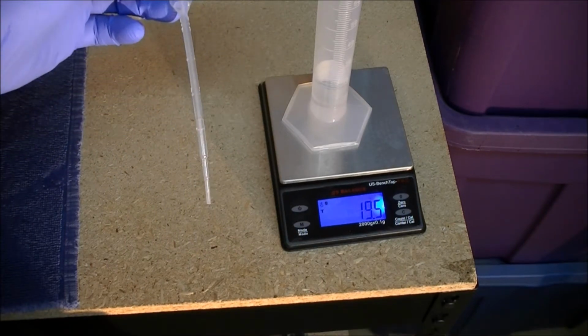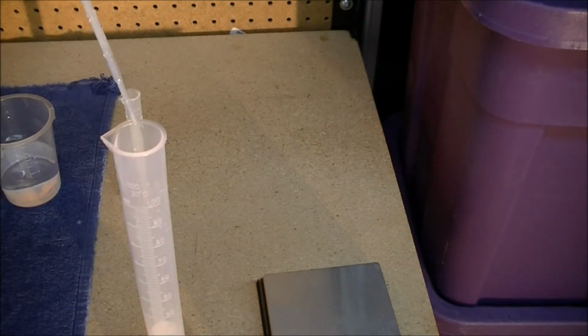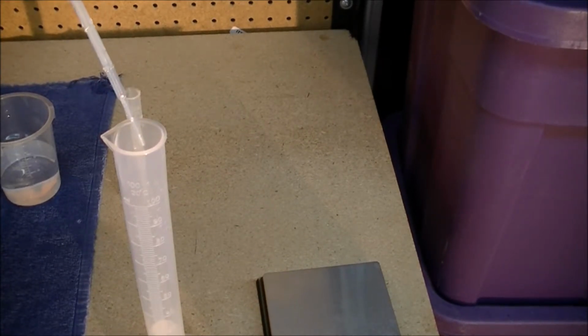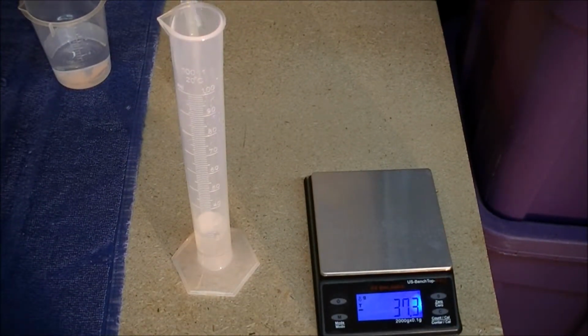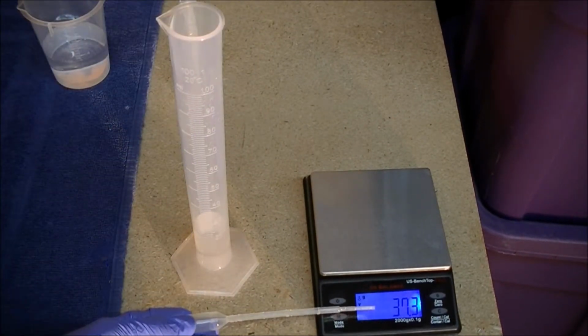That's what the medicine dropper here is for. We'd come up to the top and we'd add a few more drops. But it's important to take the graduated cylinder off of the electronic balance when adding water. Why is that? Because in science there's a phenomenon called bias. When the experimenter has in mind an expected outcome, maybe in line with his hypothesis, it might be that the experimenter adds a little more or a little less water if he happens to be looking at the mass because he's got some expectation of what the mass should be.